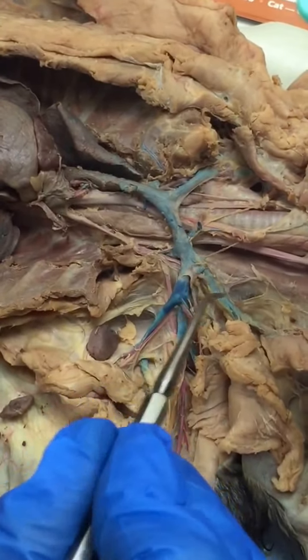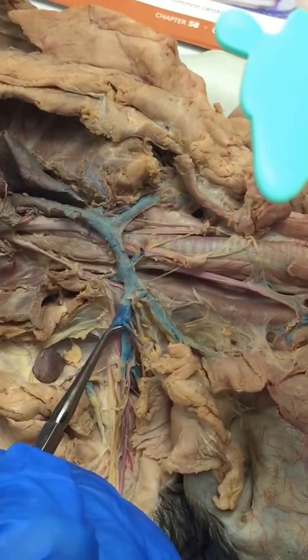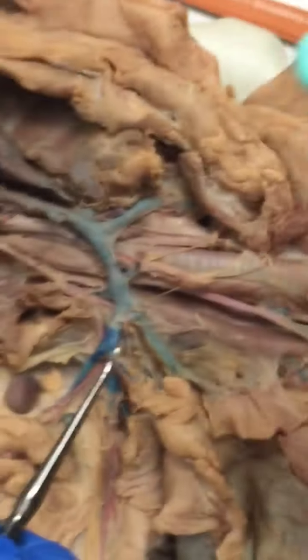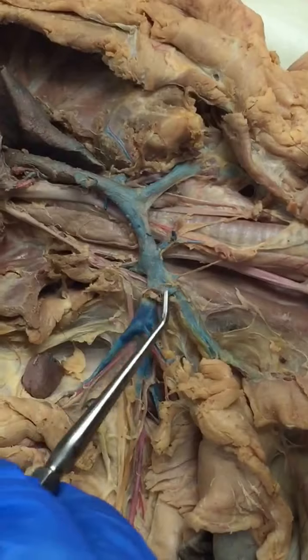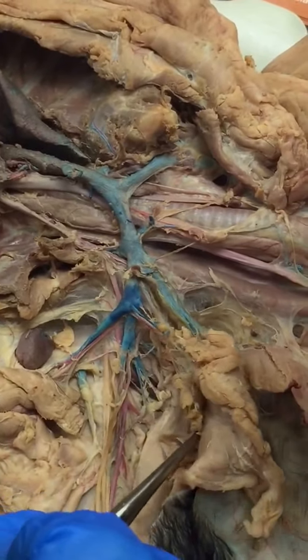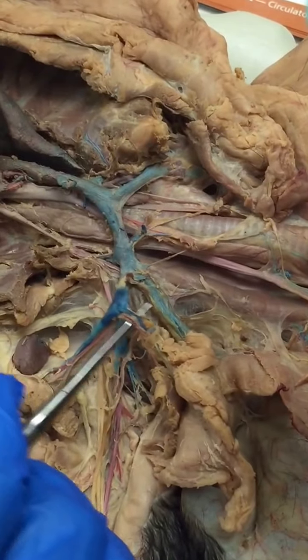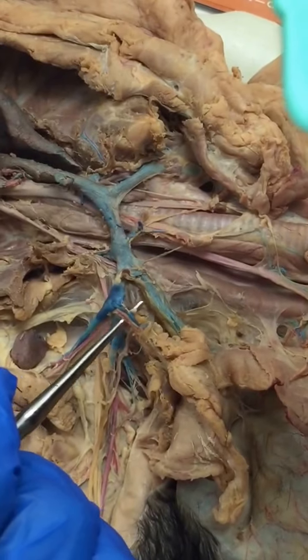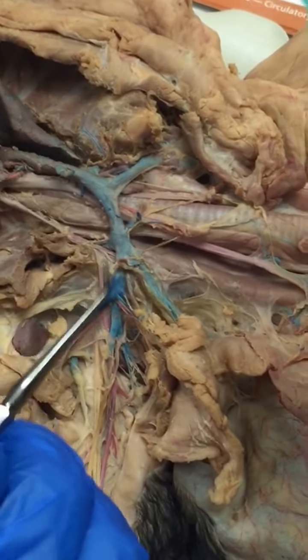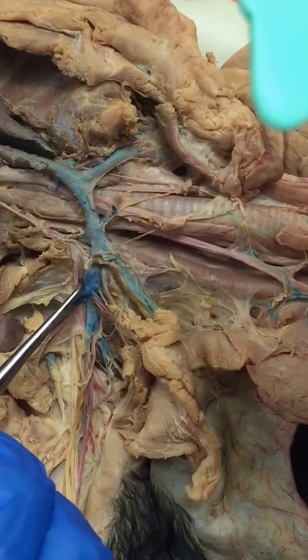And then there's this one that branches up, what was that one? Ventral thoracic. Yeah, close. Okay, so then this one, where is it? This one was subscapular, wasn't it? Or was that further down? Oh yeah, it would be this one, because it's the only other one that comes ventrally. That would be the ventral thoracic, okay? So this, and that actually branches off of the axillary here, because after this first rib, now this is called the axillary, okay?